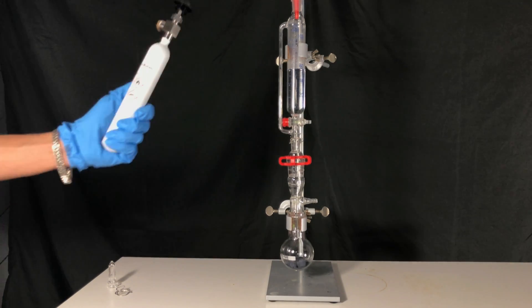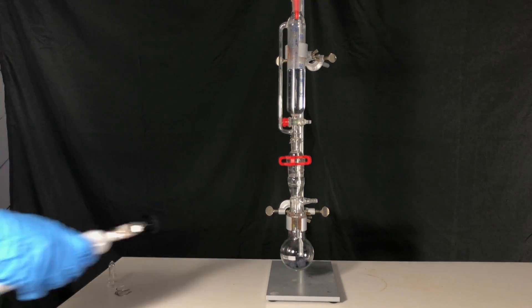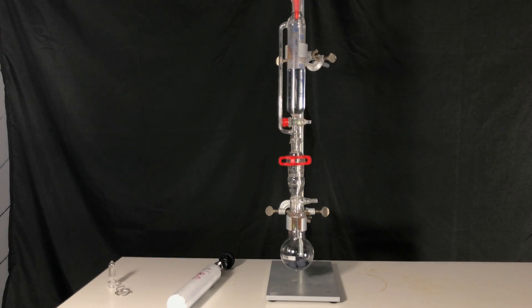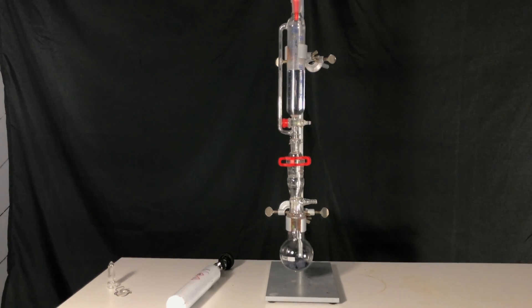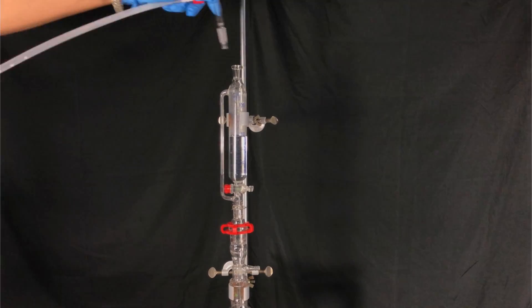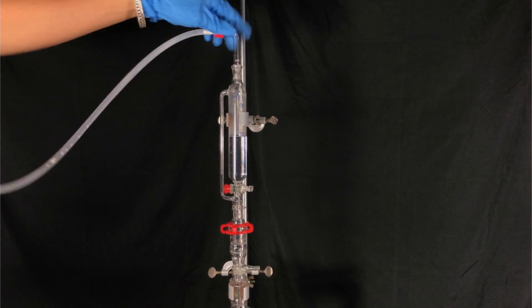Therefore, we take some butane gas. Carbon dioxide as an inert gas isn't suitable for this reaction. Silane would probably catch fire when in contact with carbon dioxide.